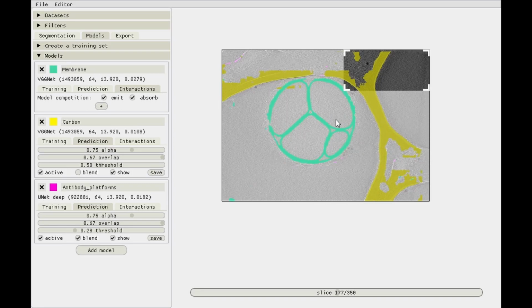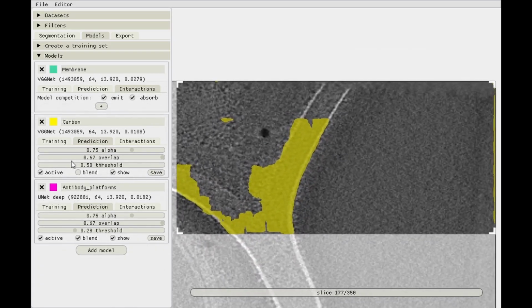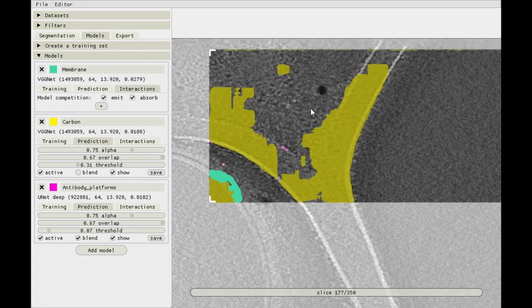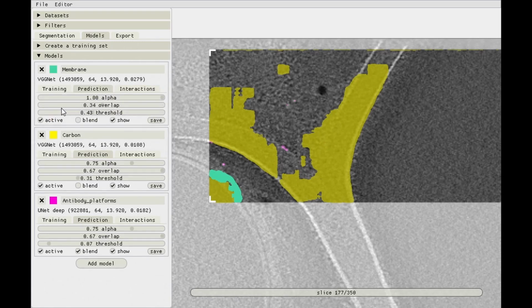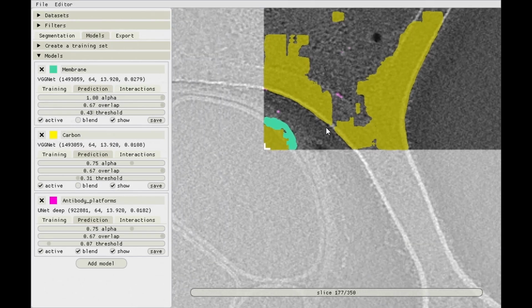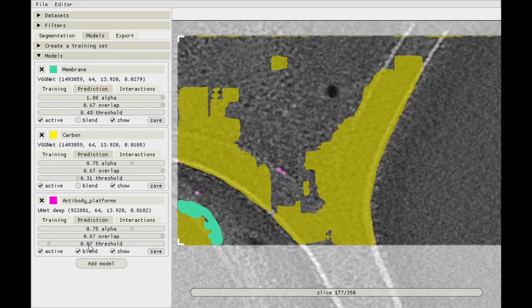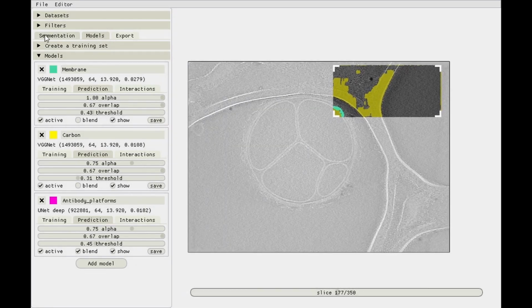Let's actually crop it so that we can get that feedback a little bit quicker. Overlap 0, and we get some membrane stuff over there, as you can see. And then the overlap to the maximum. The carbon model works better. Because of that, we get rid of the antibody platforms. So usually when I process an entire data set, say 100 tomograms overnight, or just as a background process, I set all these overlap values to the maximum, because that's usually better, and then you can get rid of these artifacts. So we've got some pink stuff over here at a very low threshold, so usually we would also set that a bit higher. So that's not too much of a problem.